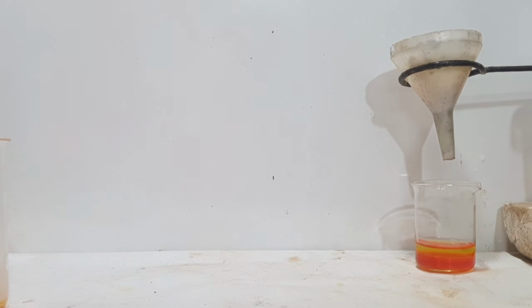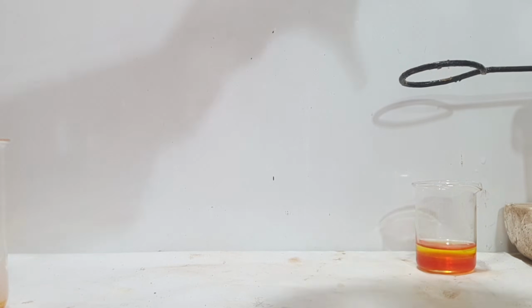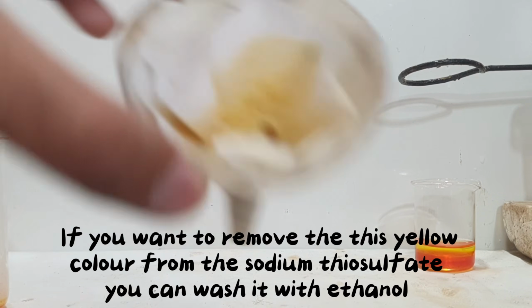One hour later. If you want to remove this yellow color from sodium thiosulfate, you can wash it with ethanol.